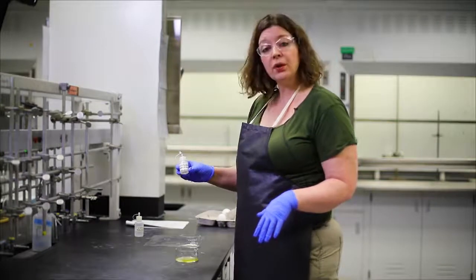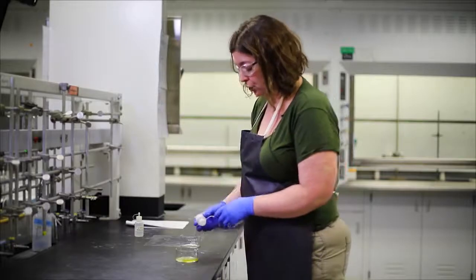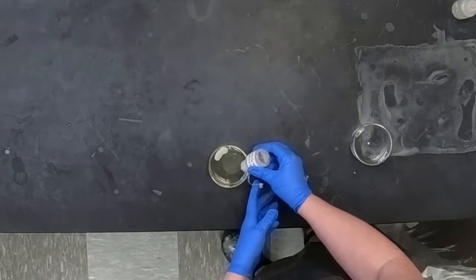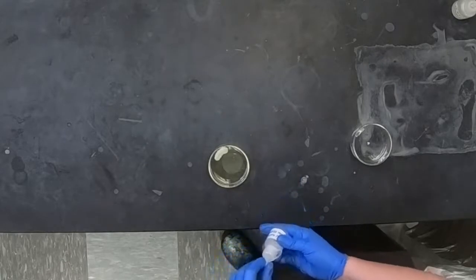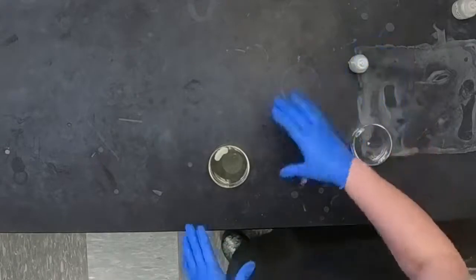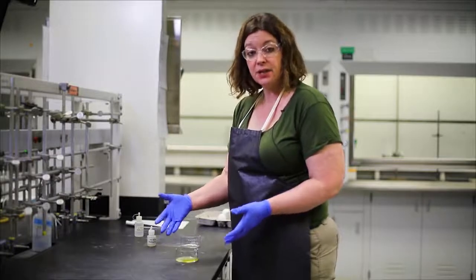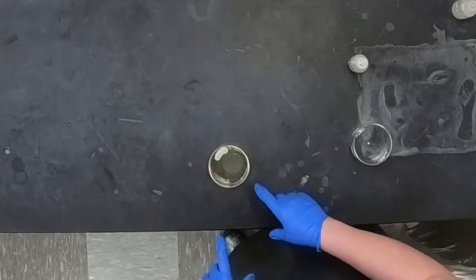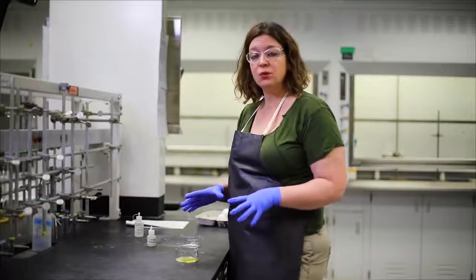I have 6 molar sodium hydroxide, which is a base, and we're going to talk about acids and bases in a few weeks in lecture. I'm going to take a few drops of sodium hydroxide and also treat my simulated eyeball. Now what you might notice is where I put the acid, right away we see burning. It looks like cooked egg, it looks like scrambled egg. Where I put the base, we don't see anything happening right away. This tells us a little bit about the difference between how acids and bases react.